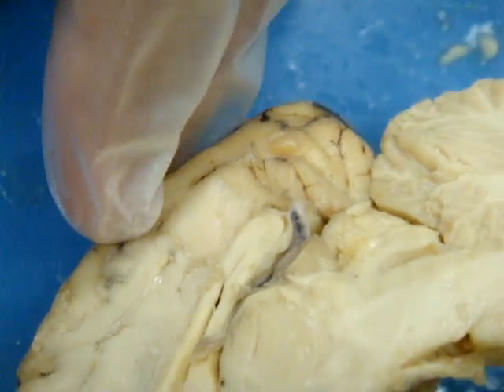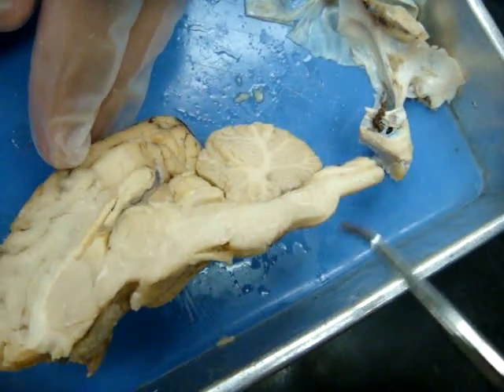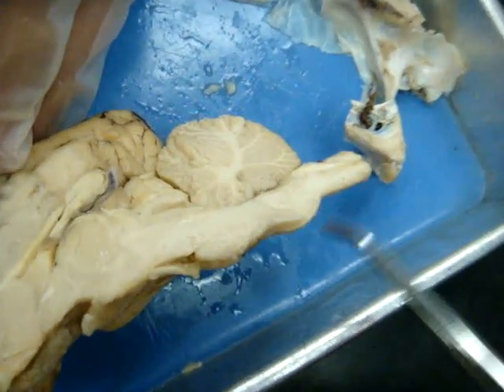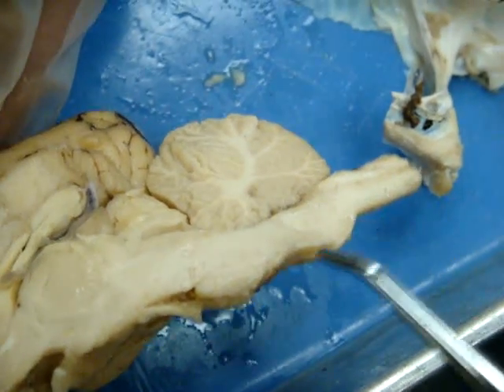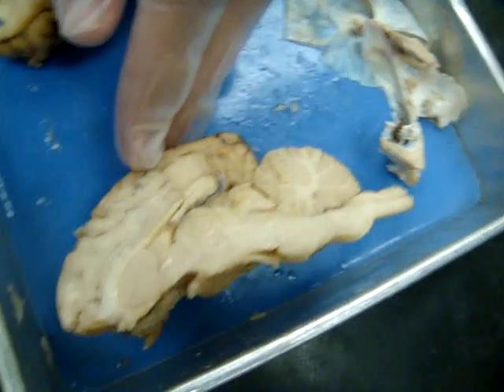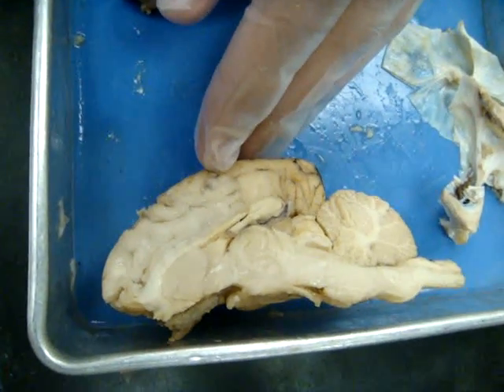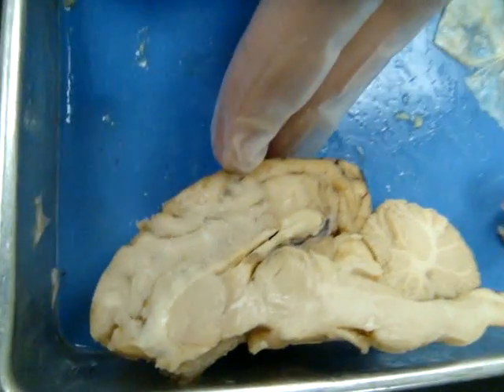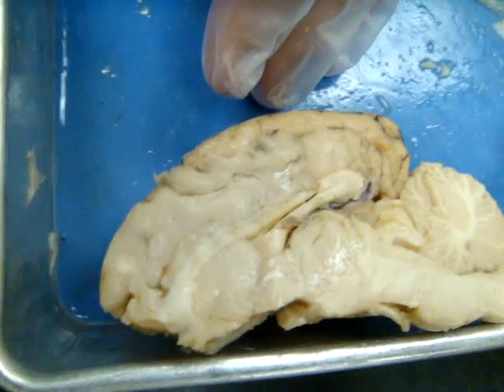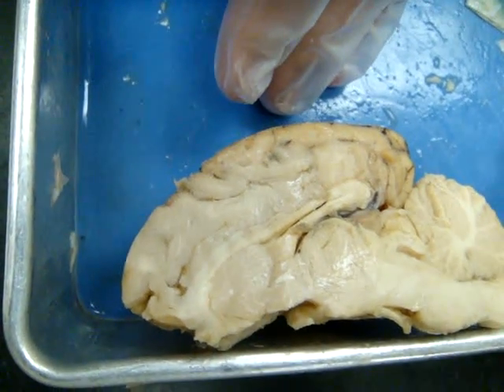And the medulla oblongata is this long part. The pons is the bump under — kind of a little bit anterior and just under the medulla oblongata. That's all we have on her list. I want to know what this one is, though.